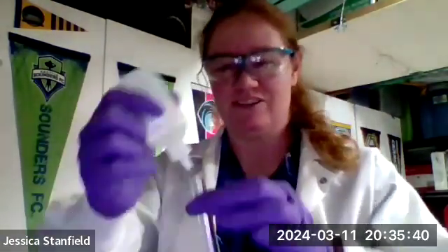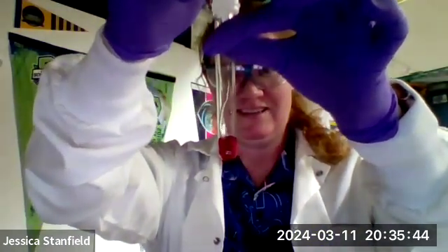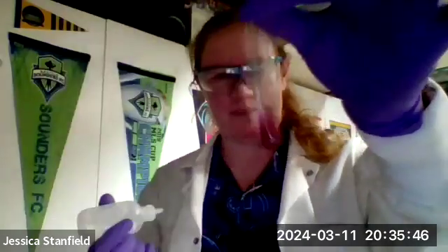Ironically enough, it's red, even though it's acidic. Different indicators indicate different colors. So I'm gonna grab my sodium hydroxide again. Now let's see if we can get this to change colors as we change the pH. Okay, so, oh, is that a different color than it was before? Yeah. So now I've changed the pH by adding the base to it. And so I can get it to change color based on the pH of the solution.